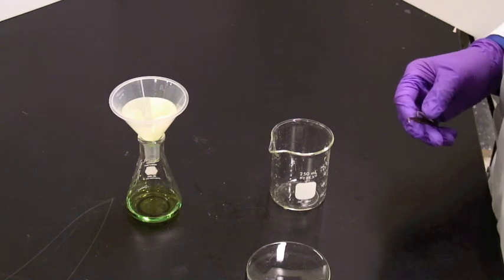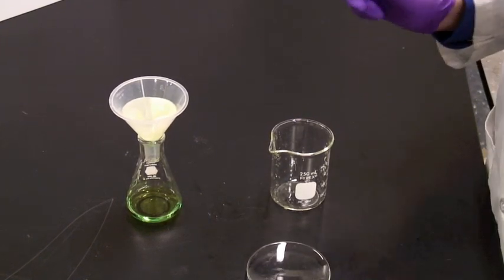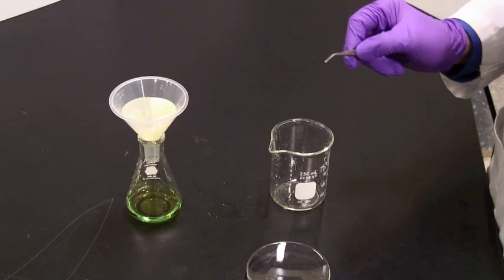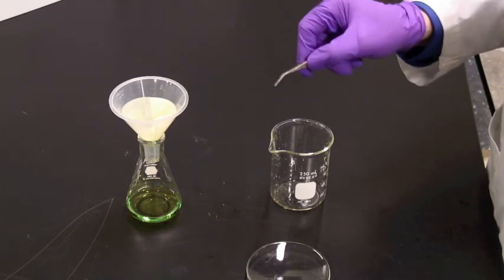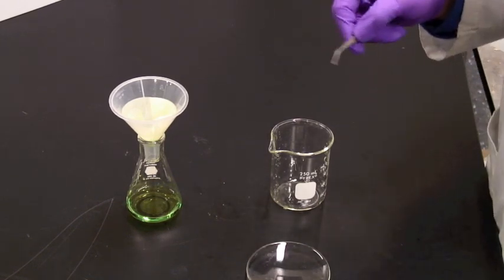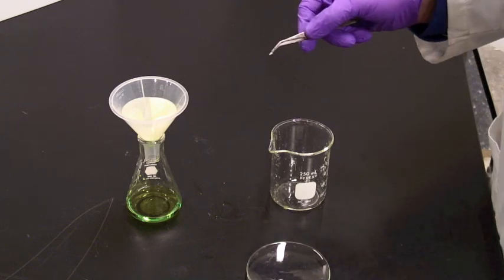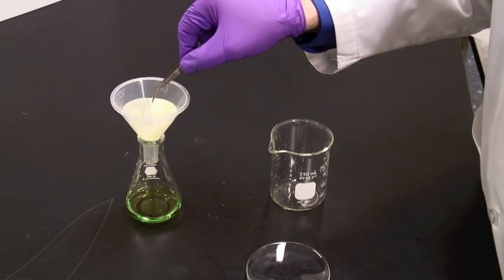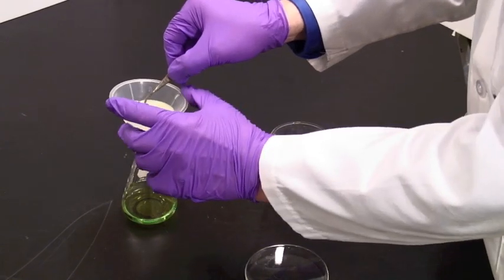Once the wash has drained through, you're ready to remove it. Now, do be careful not to overwash with either the actual solvent or a new solvent because overwashing nearly always leads to diminished product. But the washing is necessary to remove other materials.